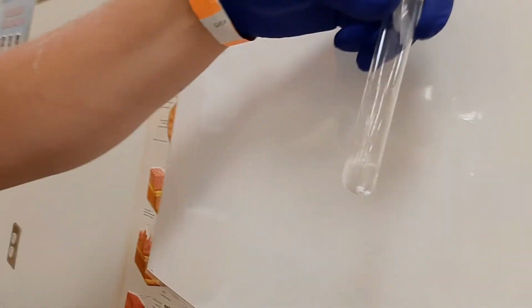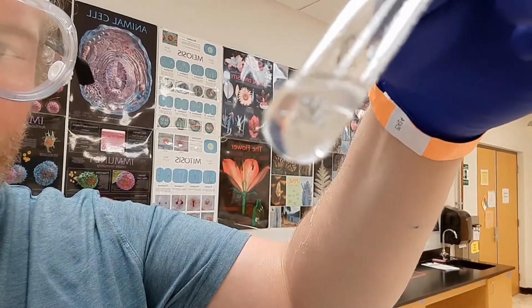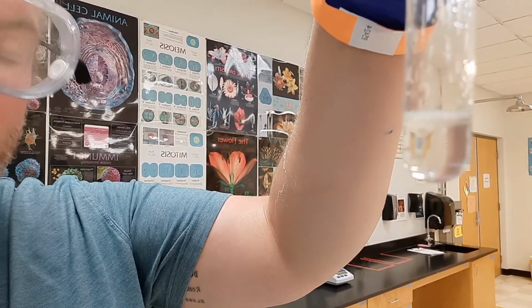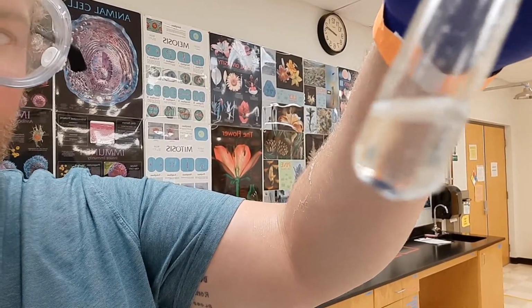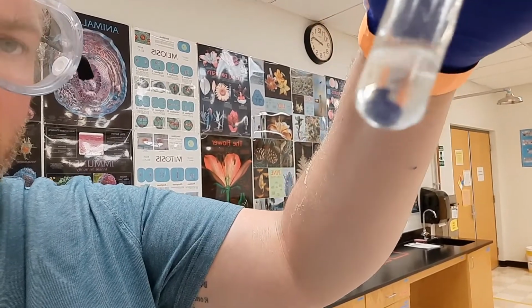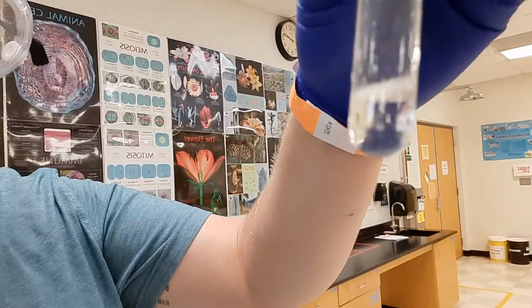What I want you to try to see with the sample is the layering that's happening in the test tube. I hope you can see that there is a small layer on top and the water layer on the bottom. When I say layers, the bottom half is water and the top half is your organic ester. The oil and water does not mix, so they layer like oil and vinegar. The oil, or the organic, is on the top. Now we need to get that top off of there so we can smell the fragrance a lot easier.